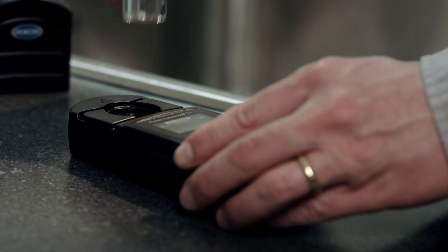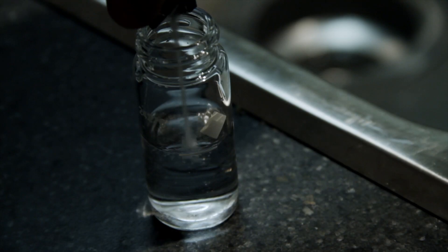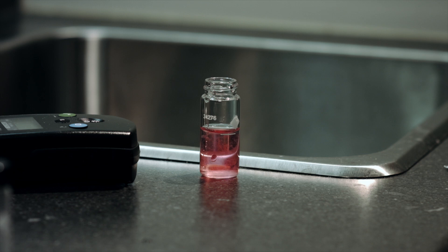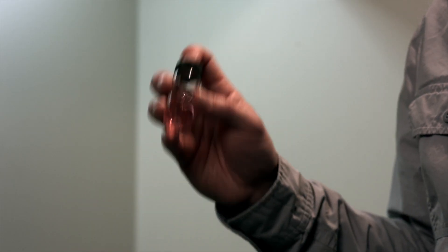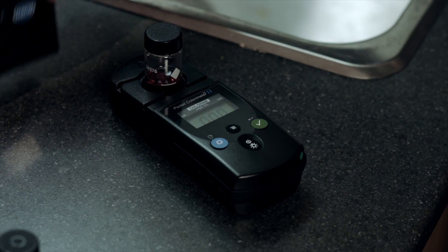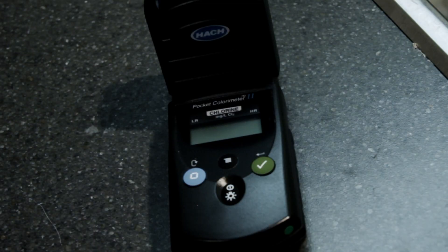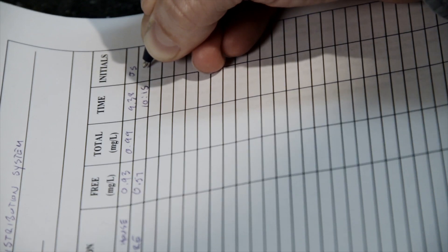Remove the bottle from the meter and add the chemical reagent from one DPD free chlorine packet. Replace the cap on the bottle and shake for approximately 20 seconds. Wipe the bottle and place it back in the meter with the diamond facing the keypad. Cover the meter with the instrument cap and press the read key within one minute of when you added your reagent to the bottle. Record your result along with the sampling location, date, time, and sampler initials in your log form.